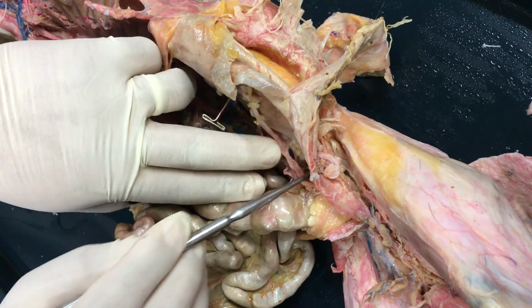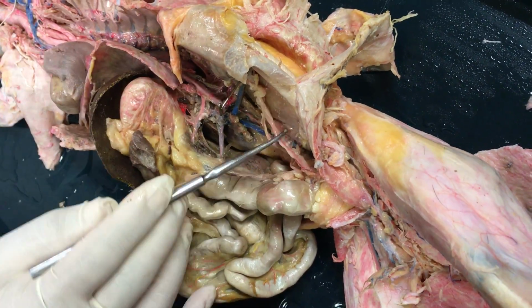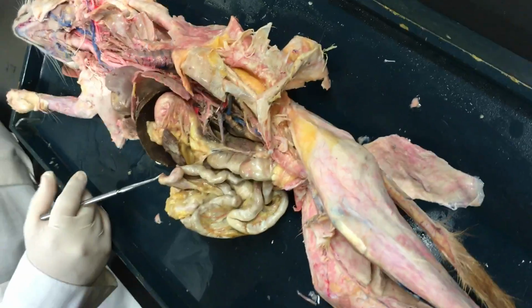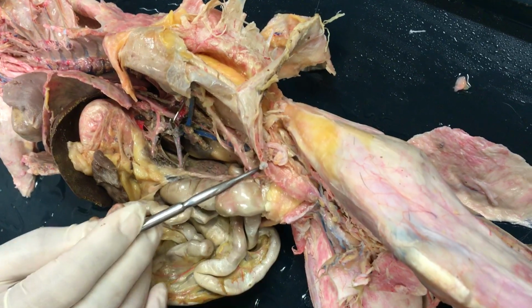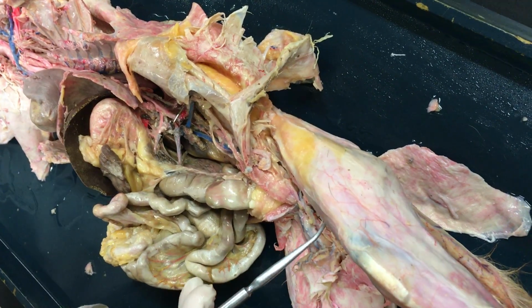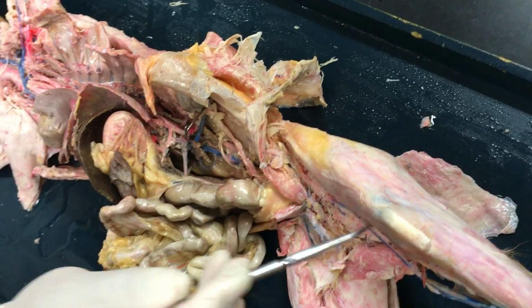And as we get deeper here, it's harder to see now, but that abdominal aorta would then branch into the cat's external iliacs, which then supply the femoral arteries. And then you would have small branches of the internal iliacs, even deeper to that. And then once you make your way out of the abdominal cavity, you have your femoral artery. And on the cat, that's where we would stop.